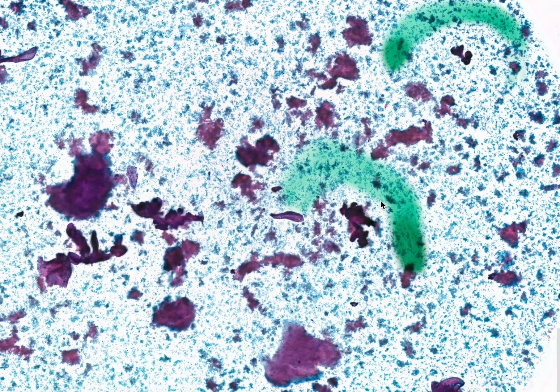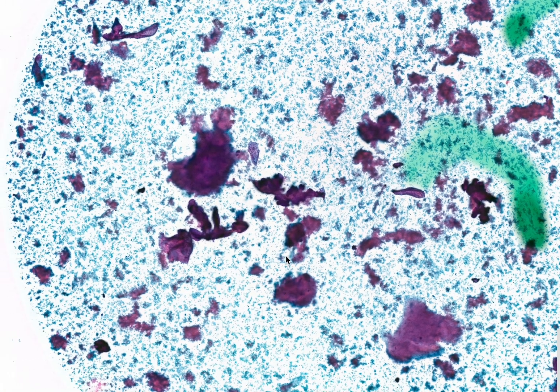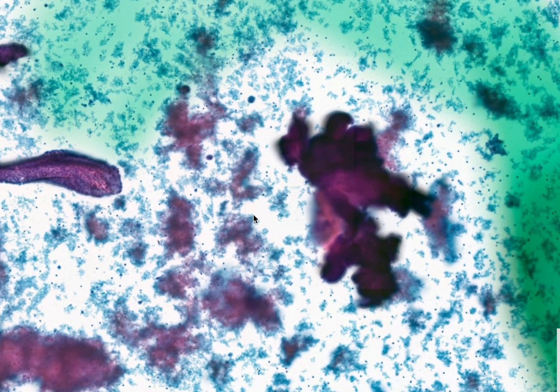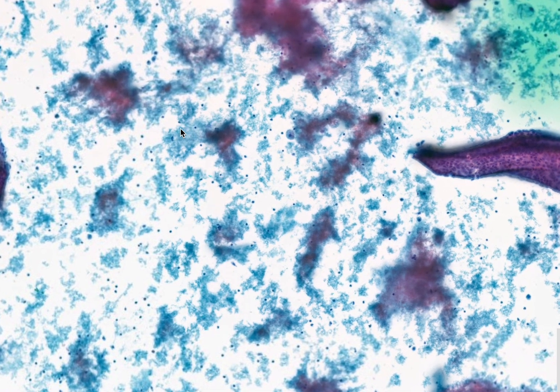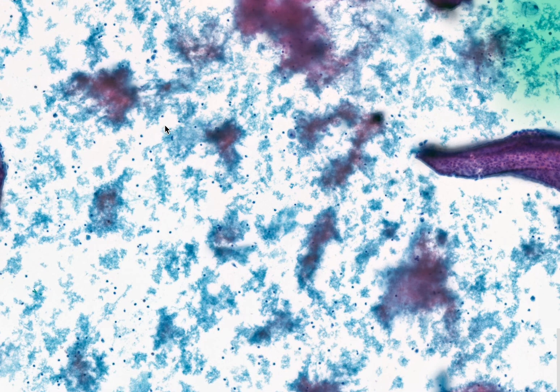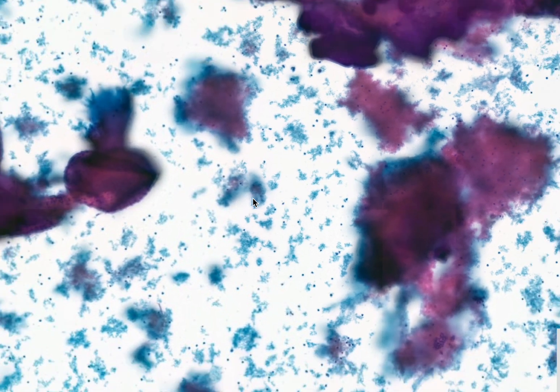Here there are a few things marked, and even in this image you can see it's a fairly cellular smear with lots of clusters — 2D and 3D clusters here. If you look at this cluster, it actually looks more like a papillary fragment than a cluster. And if you look at the background, that's the amount of necrosis. Remember, it's a centrifuge sample so necrosis will not be very fluffy — it will be concentrated. This is how necrosis looks in a centrifuge sample, and there's definitely a good amount of 3D clustering happening here.